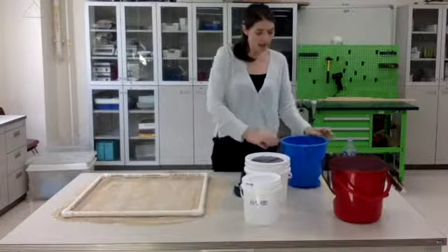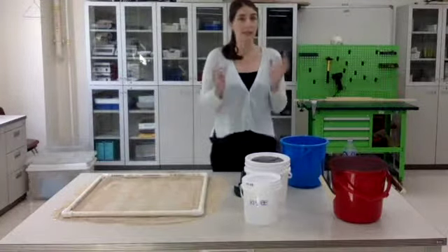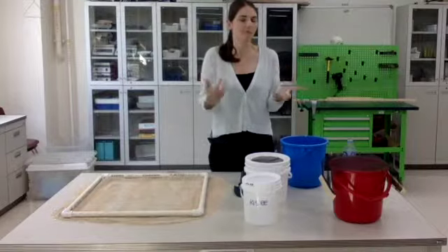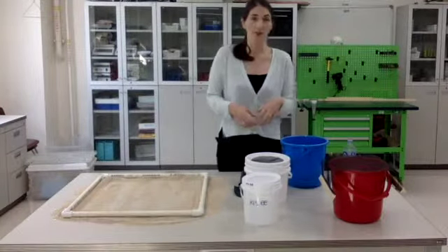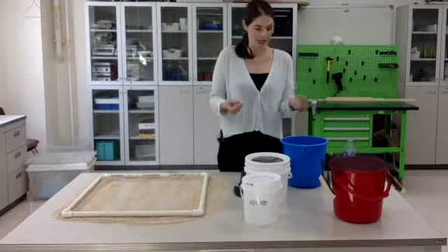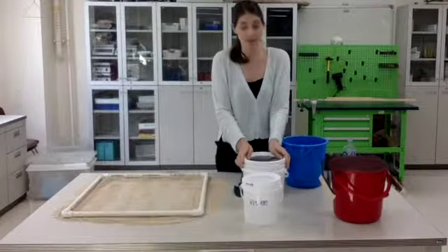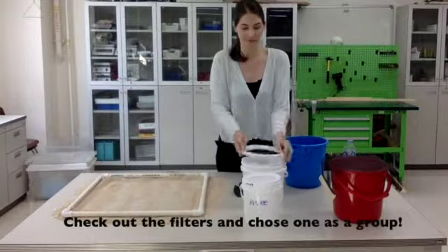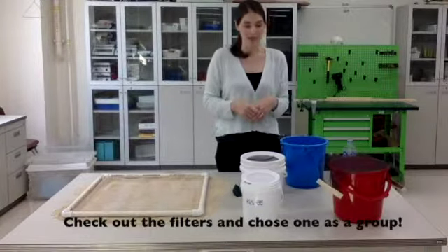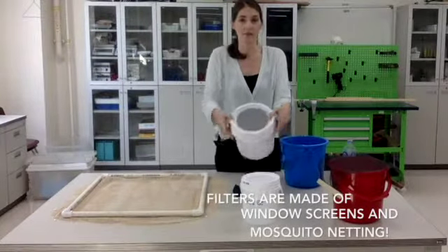Now, I want to go ahead and get all of the microplastic pieces out of the sand. Now, microplastic is about 5 millimeters or less. You can get things a little bit bigger, and some things that are smaller, you just can't see. So what I want to do is filter out the really fine sand particles, stuff that I know is not plastic. So you have to choose a filter. Now, I have a lot of different filters I made. So I'm going to try using this filter right here.